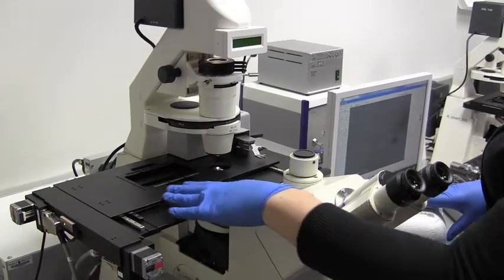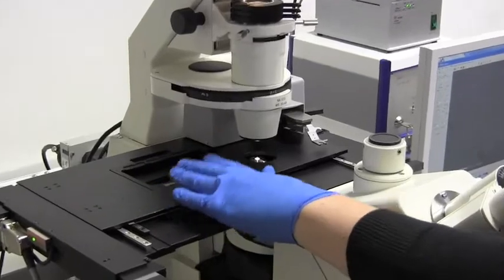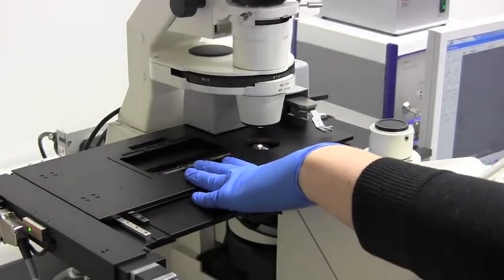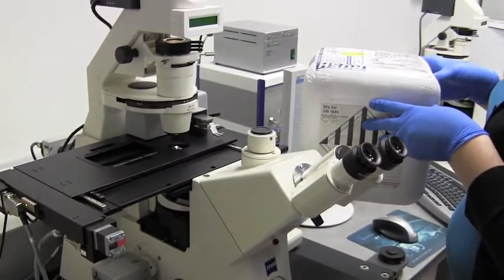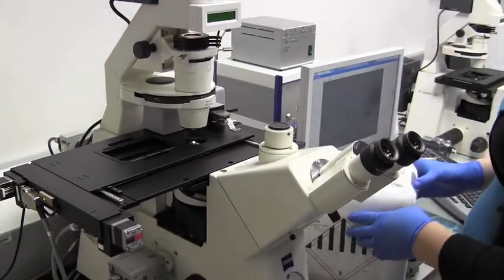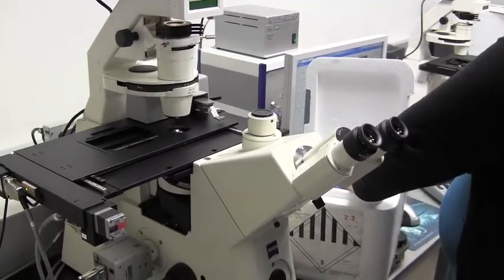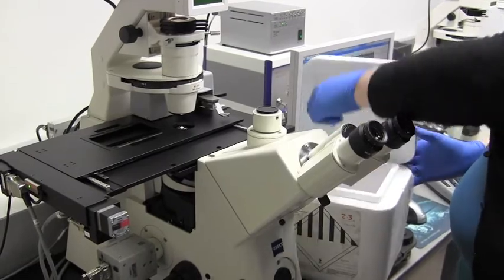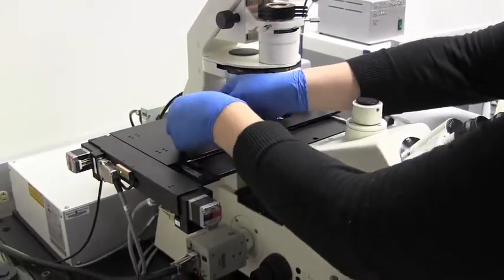With the stage in this position, you'll then have access to these clips, which hold onto the slides. Three slides can be mounted on the stage at a time. We keep our slides on ice from our cryosectioning from the day before or a few hours before, preferably, to keep any metabolites in their natural state as possible. And they can be mounted like this.